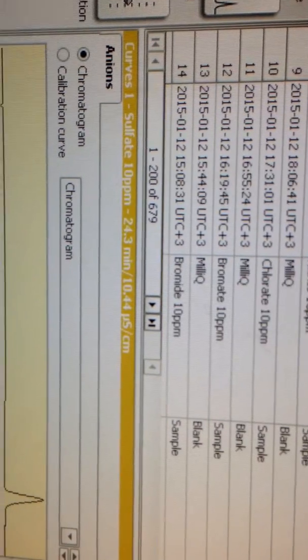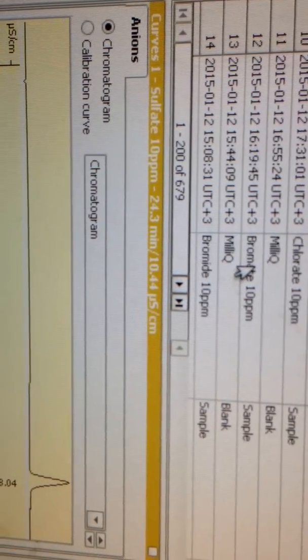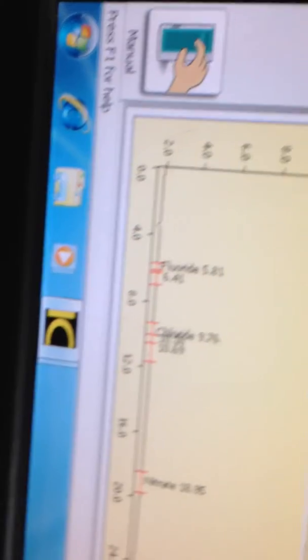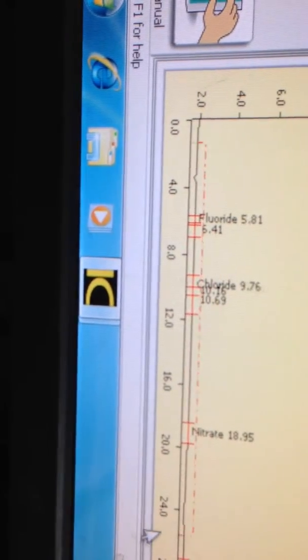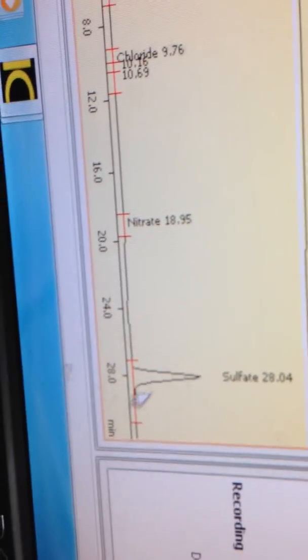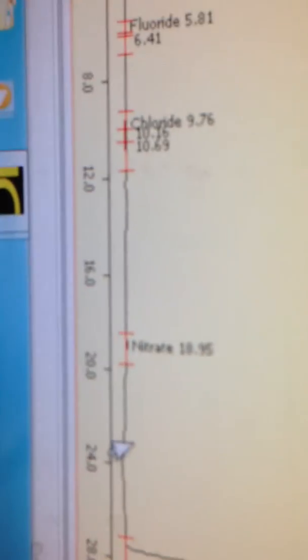So this was a previous run, and in between them I was injecting water, Milli-Q water, to see whether maybe there is a contamination carrying over, to clean it. But it seems like, if I zoom this in, it's very little compared to our peak here. This is the sulfate, okay, and these are the little blips here.